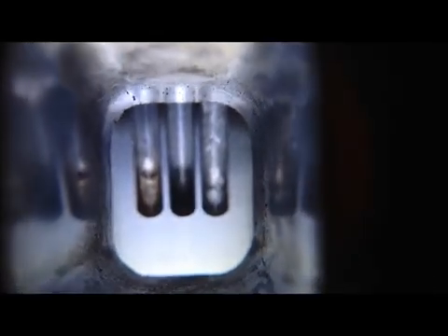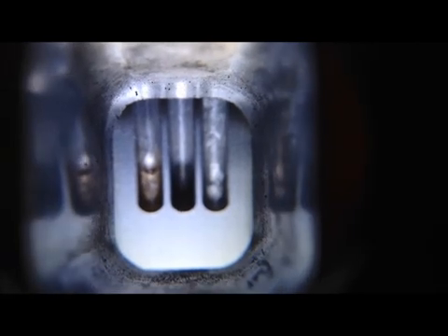Focus. Focus in. It's about the best I can do right now guys. Sorry. You'll have to see it when you come to lab more clearly. So I'm just watching these crystals. I'm focusing in trying to see when they start to melt.